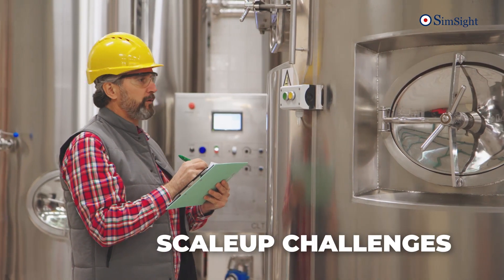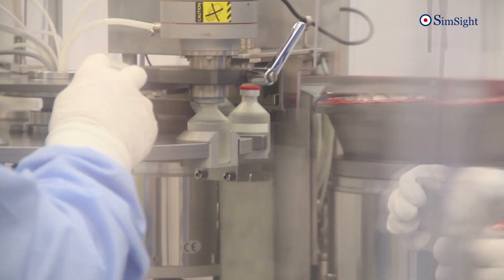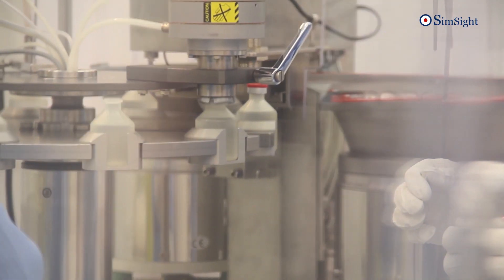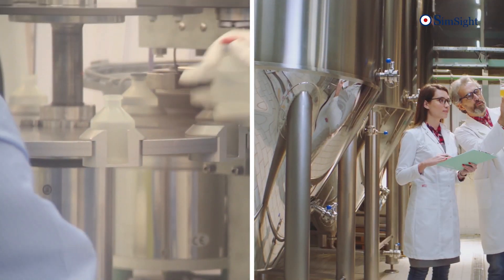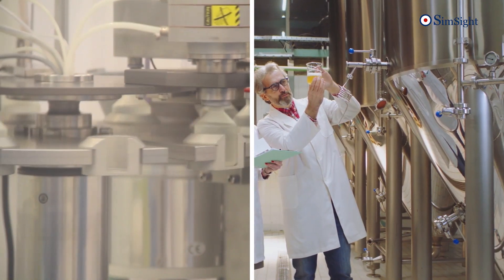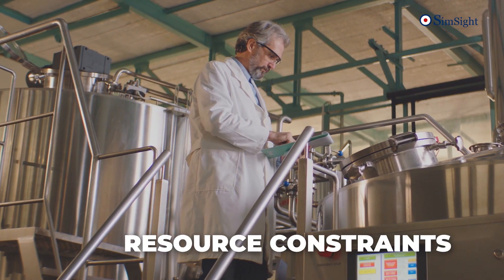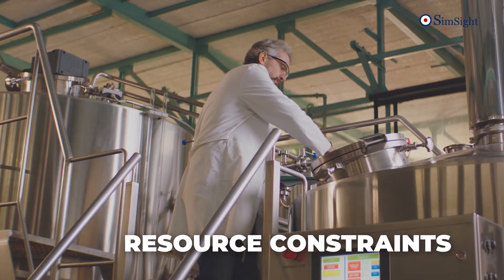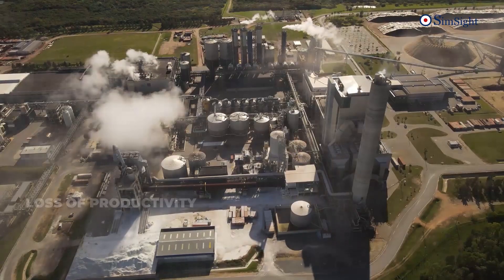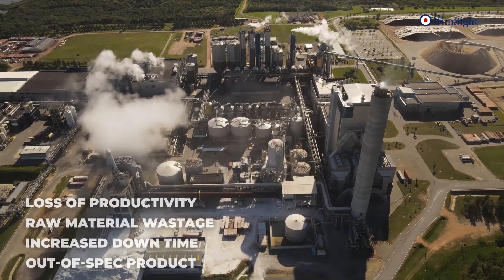Process engineers confront several challenges every day in scaling chemical and biological processes to satisfy industry objectives. Failing, which leads to inefficiencies, costly errors, and resource wastage.